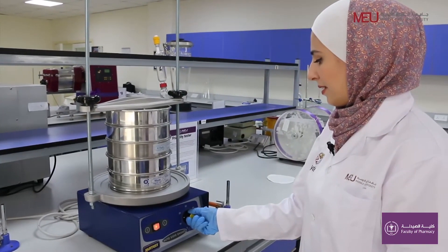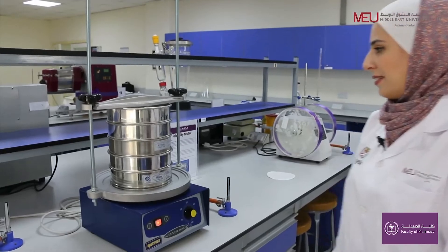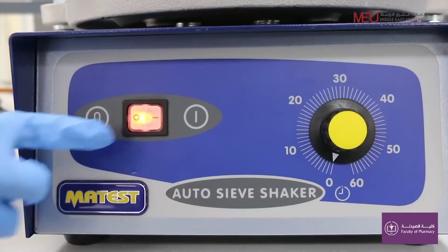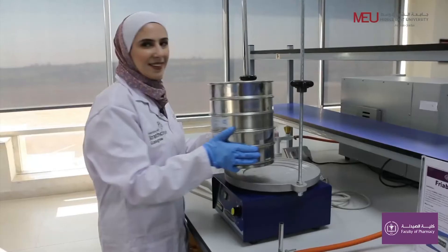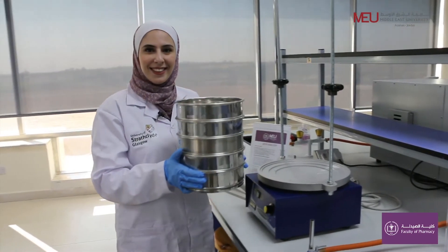Turn on the shaker for 10 minutes. After the shaker has stopped, weigh the sample retained in each sieve.